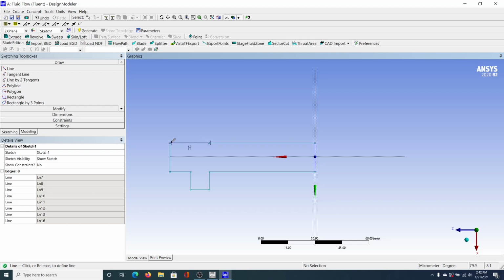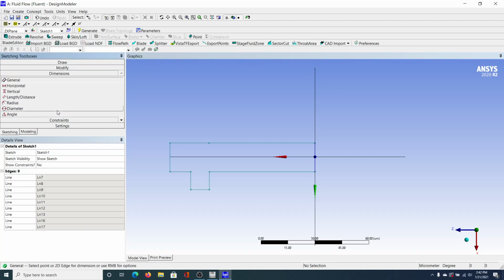Okay, so we're going to close out the shape. And we've made our basic overview of the shape. So next thing we want to do is set dimensions. So I'm going to click dimensions there. And first thing I'm going to do is a length distance dimension, okay? I'm going to set that length distance between this line and the Z-axis. What that's going to help me do is ensure that everything is symmetrical. So I'm going to click that line, and as you can see, it just came up with these dimension arrows. So I'm going to click that.